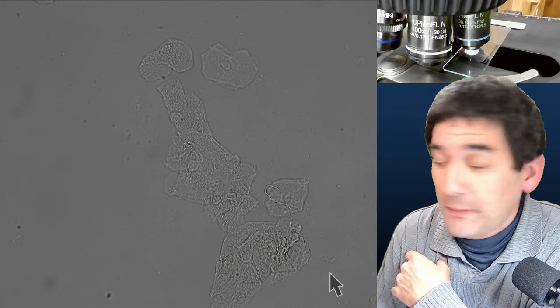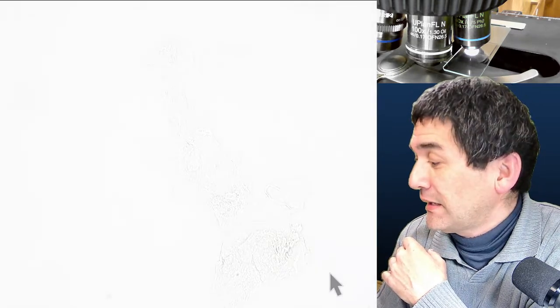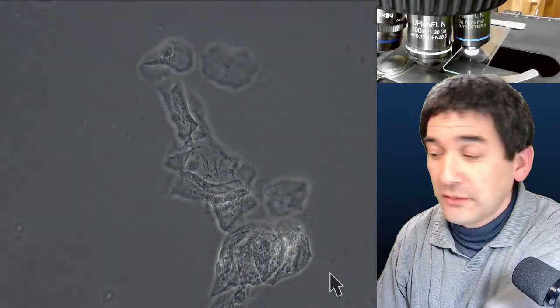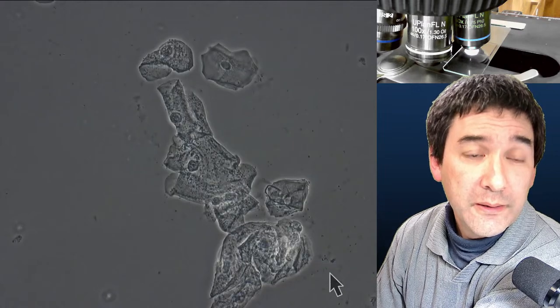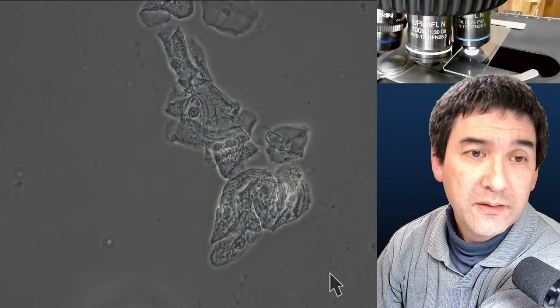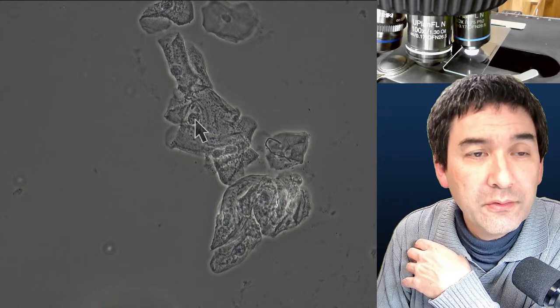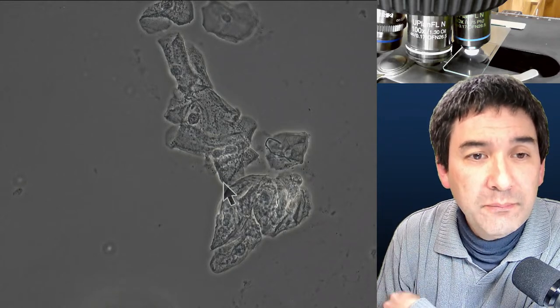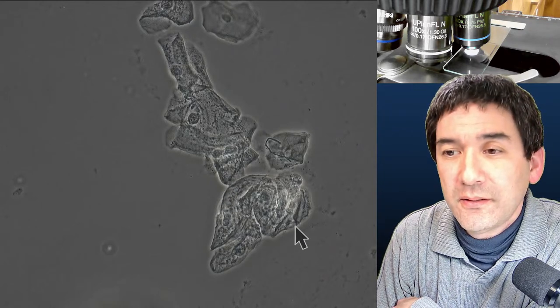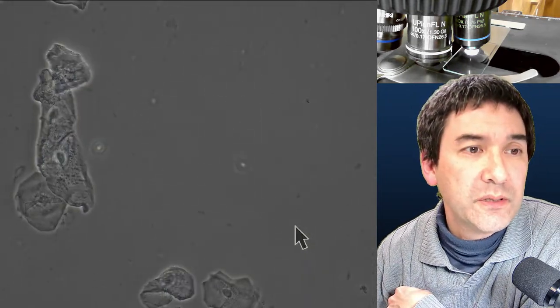Now I open the condenser and engage phase contrast. And this is how it looks — all of a sudden we're able to see quite a few more details, especially the nuclei. Again, the typical characteristic: a bright fringe or halo around the specimen. This is a clear demonstration of the benefit of phase contrast for unstained transparent specimens.